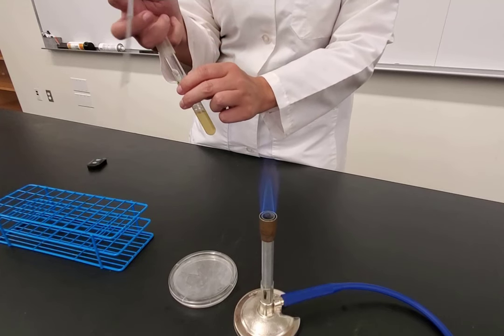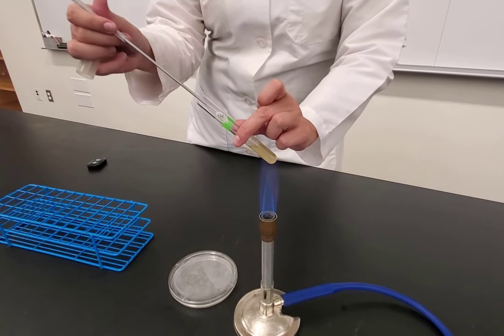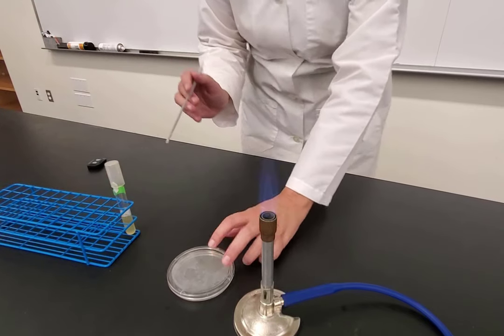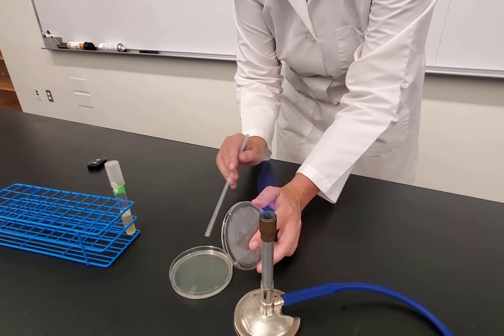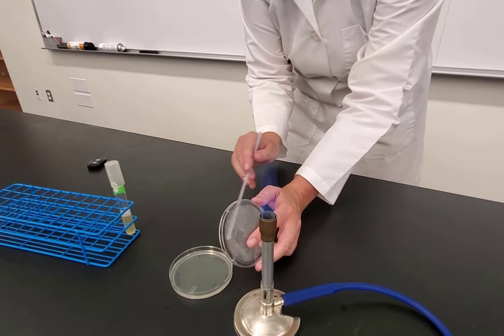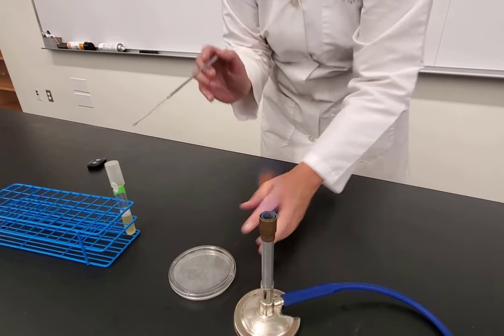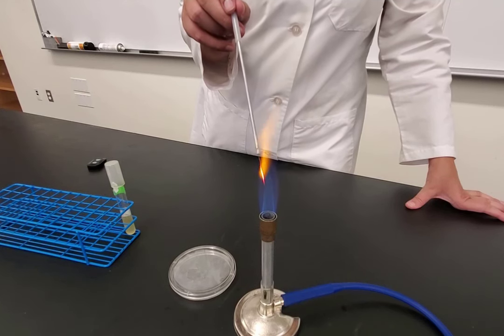When ready, flip the plate over so it's agar side down. Pick up the tube with the broth and vortex with your finger — not flicking with your nail — to mix the bacteria so it's not settled at the bottom. Take the cap between your pinky and ring finger, don't set the cap down, flame the opening of the broth, and stick the cooled loop inside. Keep the broth stable, flame the tube, put it down. Now fill in quadrant one going one line down and side to side.